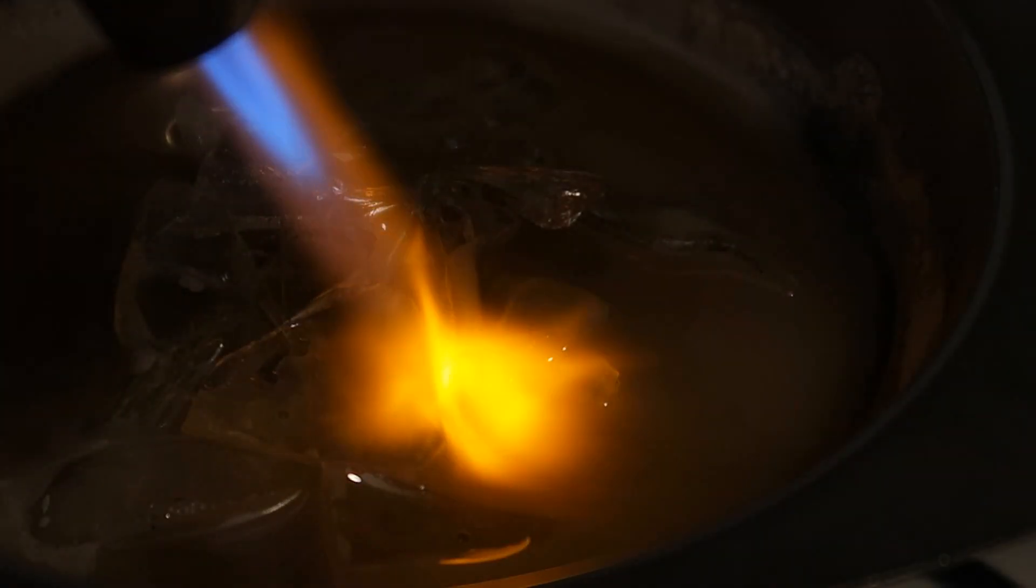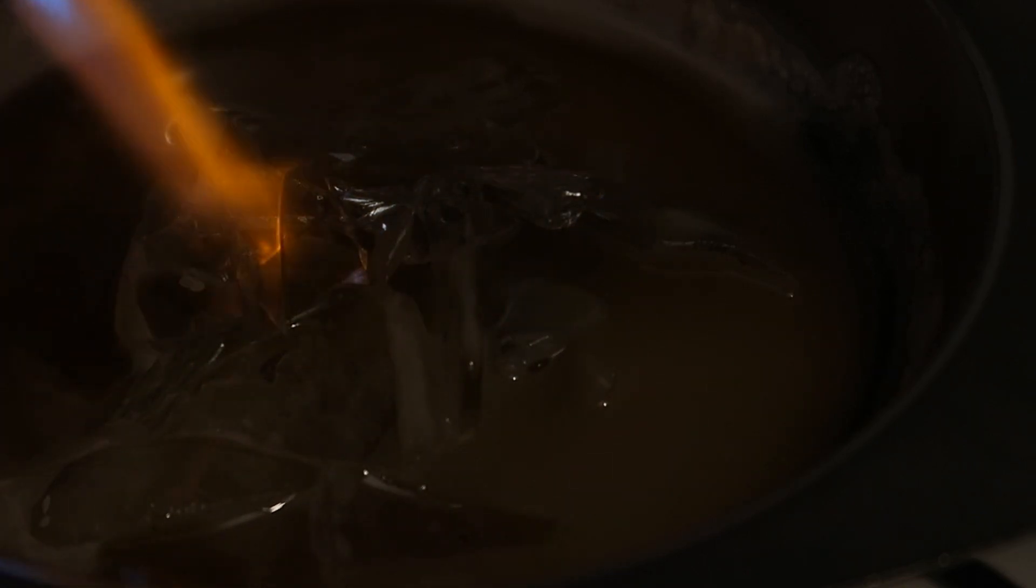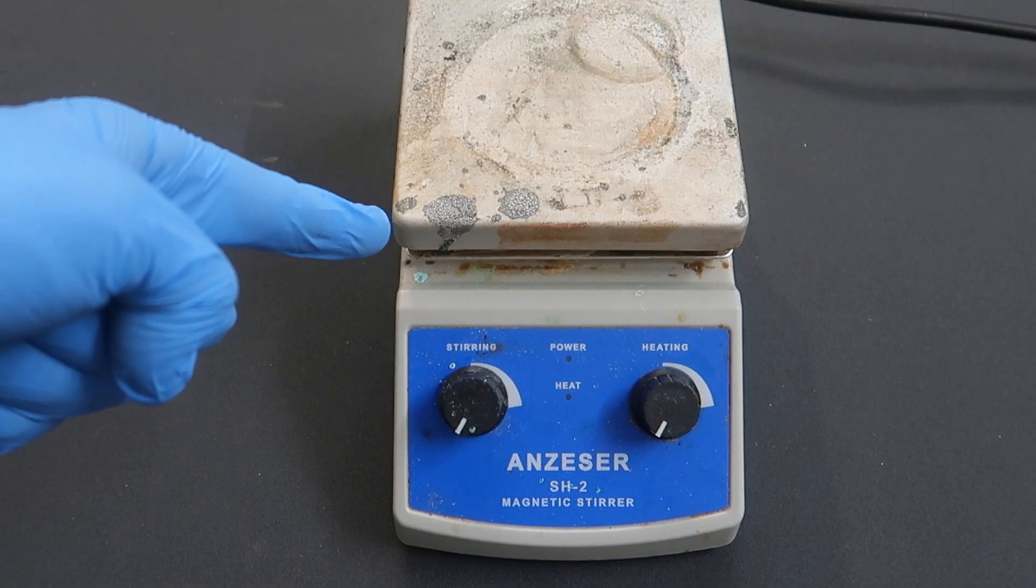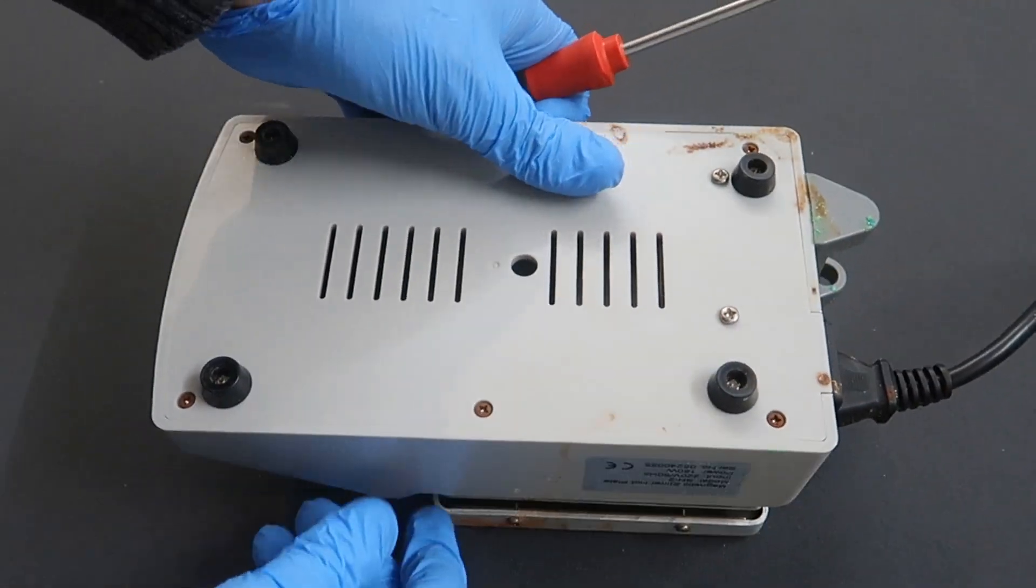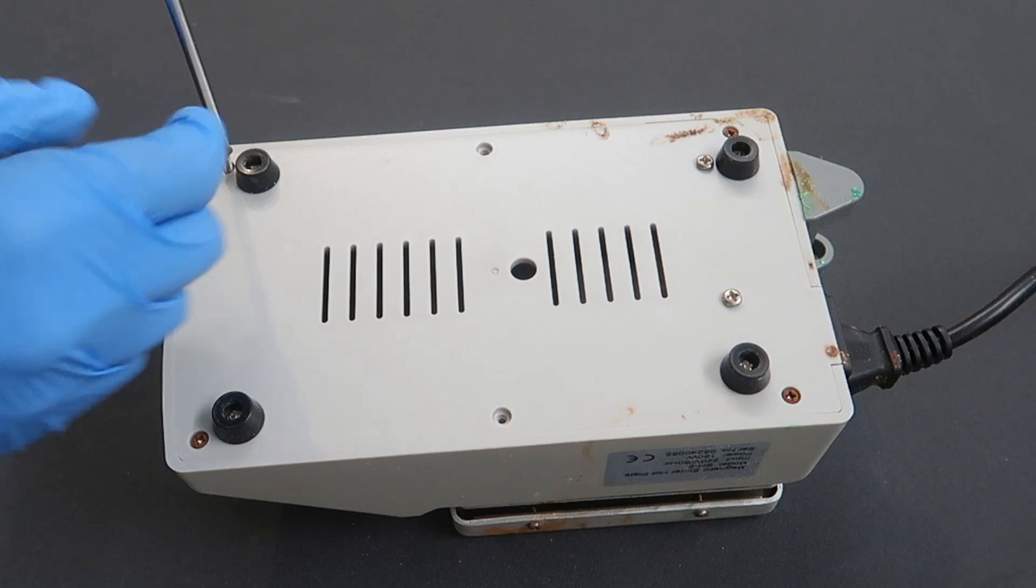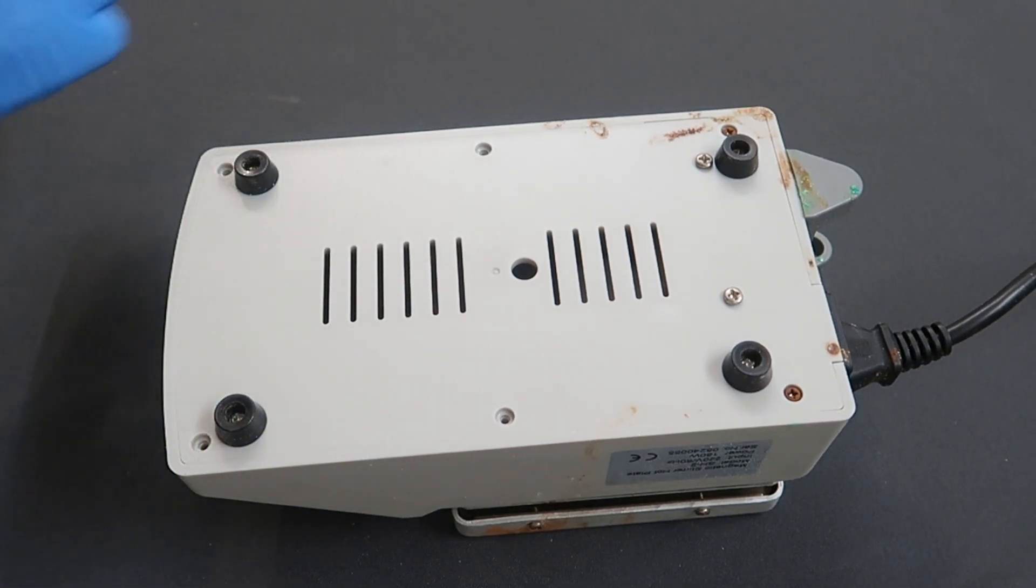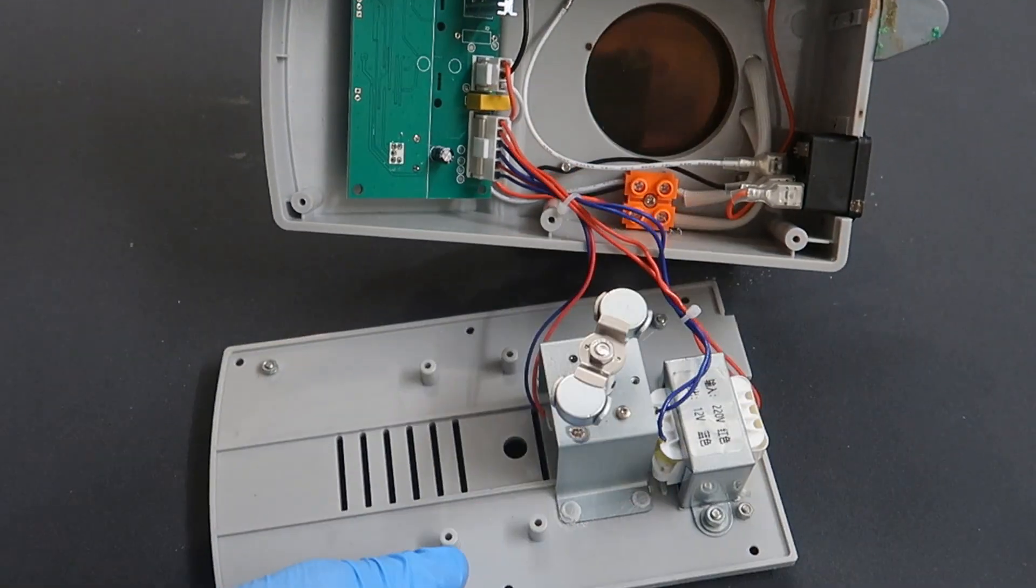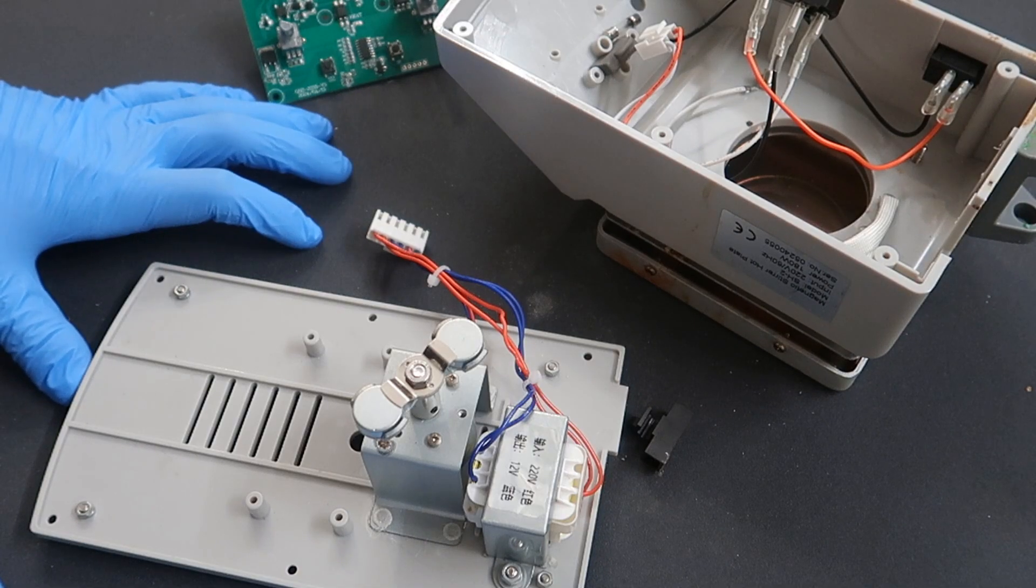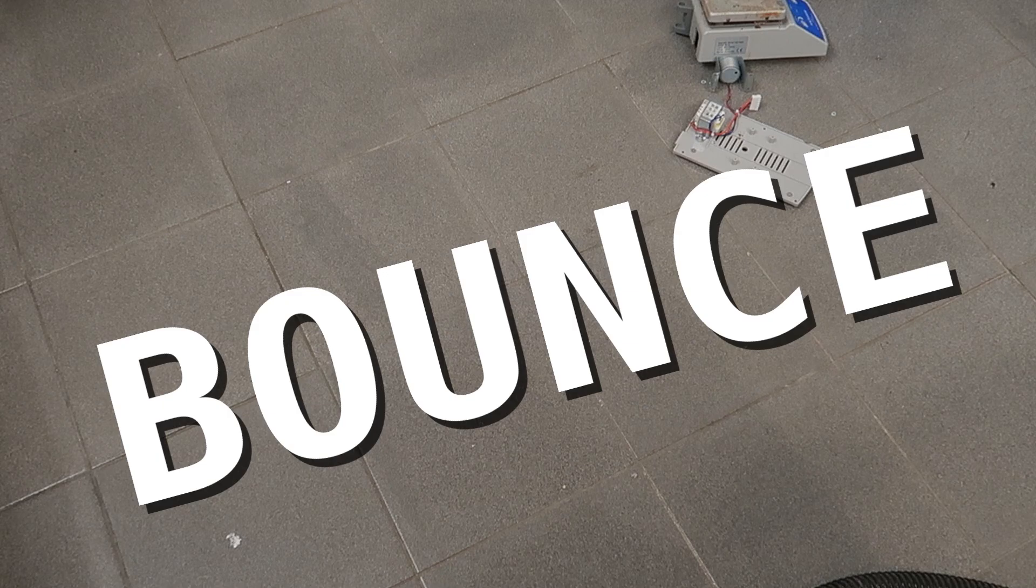Anyways, I kept on heating and stirring the solution for a while, and then all of a sudden... Blackout. No lights. After a bit of investigation, it turned out that the problem was coming from the hot plate. I then took on the side quest of disassembling the device and identify where the problem was coming from. After testing several components and checking datasheets, I was able to come up with two conclusions. Conclusion number one: I suck at electronics. And conclusion number two: It don't bounce.